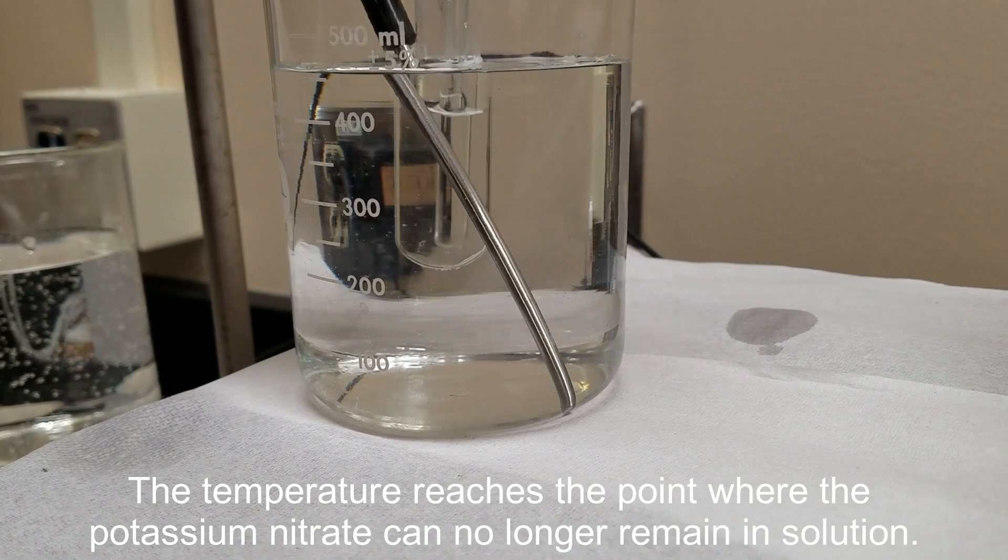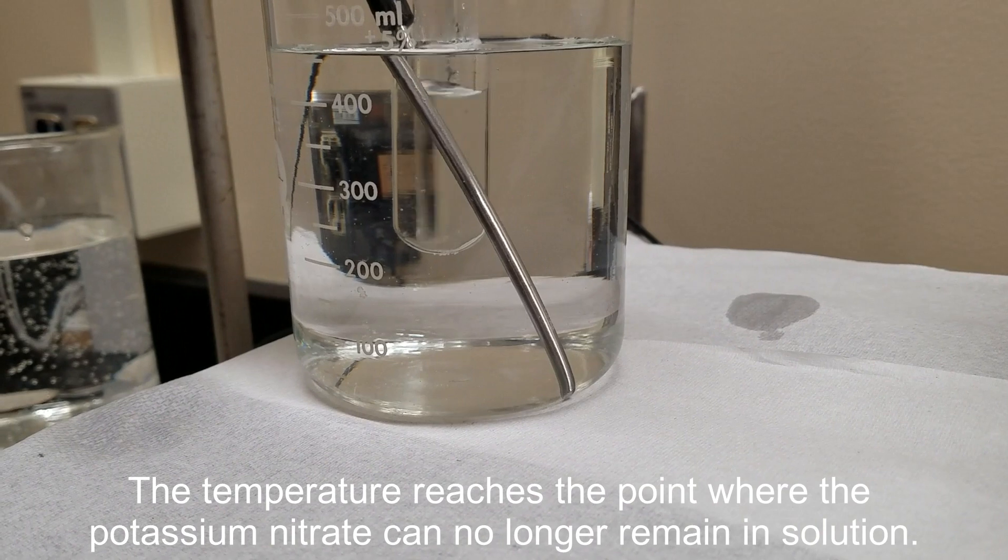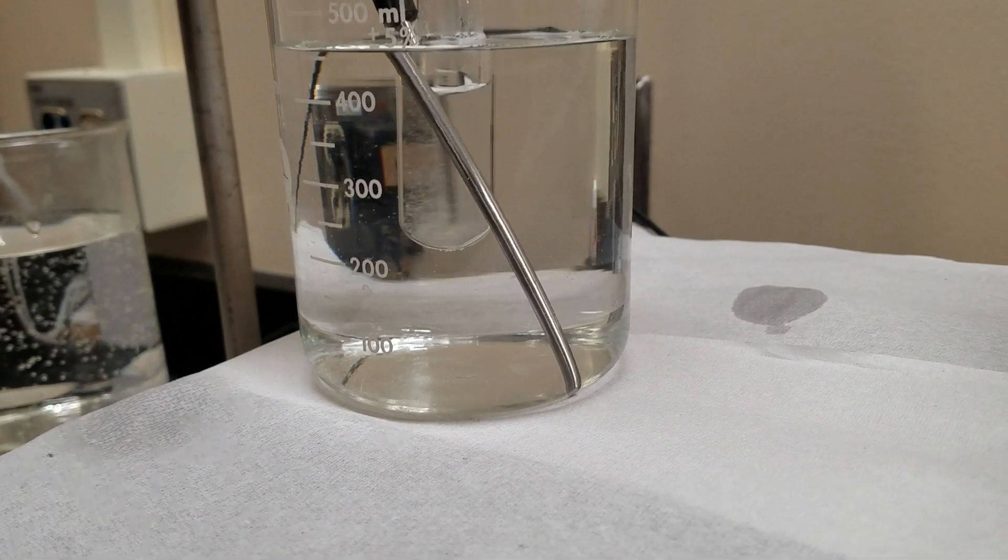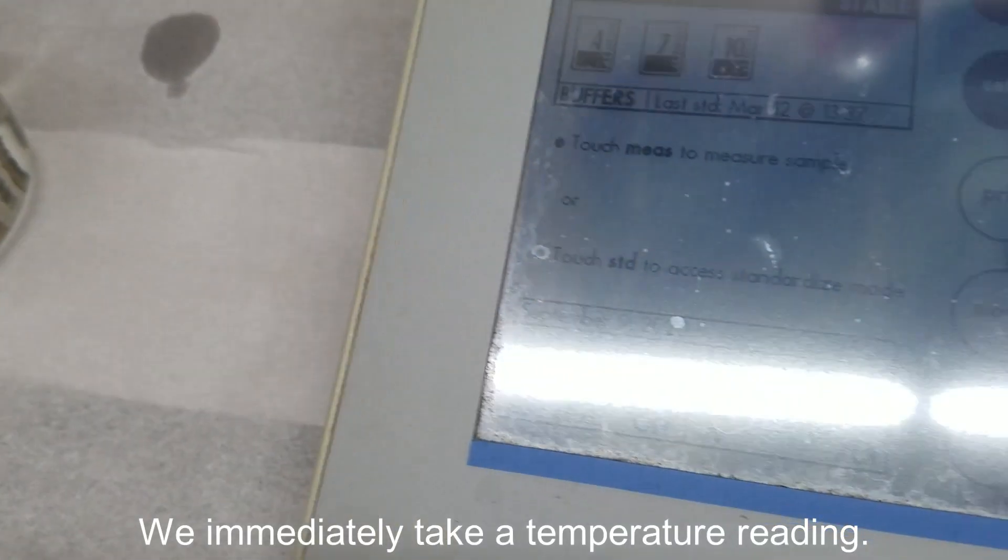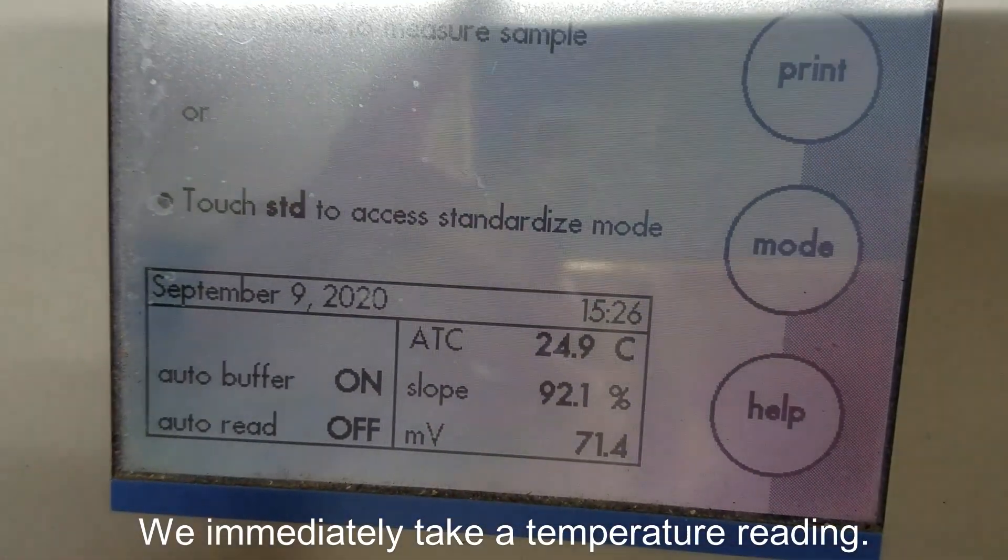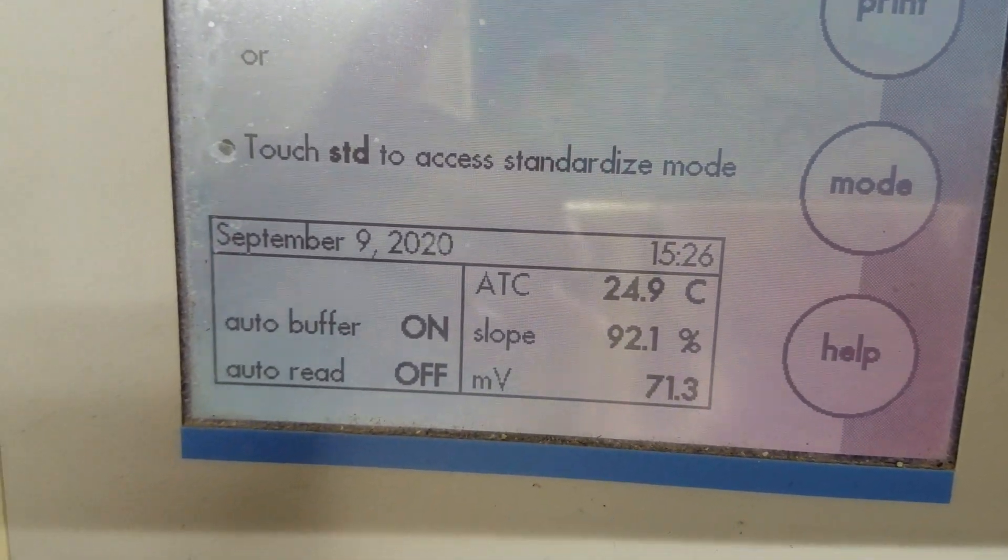See those tiny flecks? And in just a few seconds we start to get a blizzard of precipitate. At that exact moment read the temperature. That is your saturation temperature.